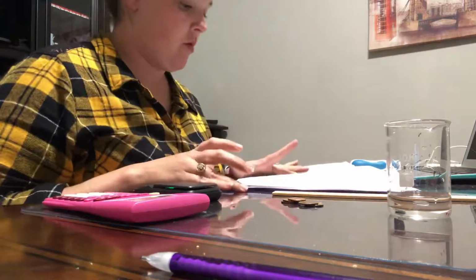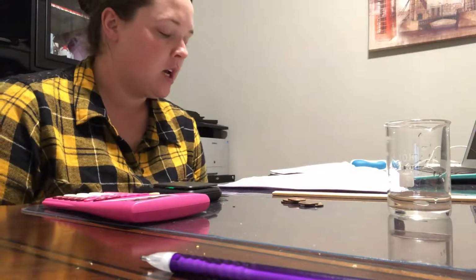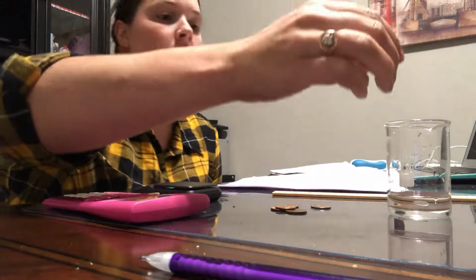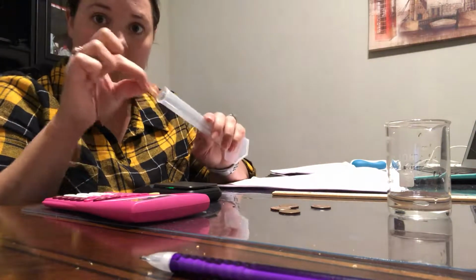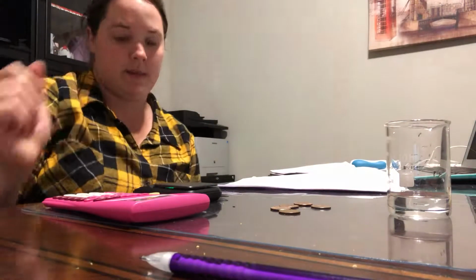Okay, so for the density lab, I have to fill out this data table. For this data table, I needed 5 pennies, which I have right here on the counter. I needed a graduated cylinder, but this is the only one that came with the lab, and it only goes to 25, and a penny couldn't fit in there. So I'm using a beaker. And then for the other part of the lab, I needed a ruler, which I used to measure my phone, and the mass of the phone, and then I need this little guy here.